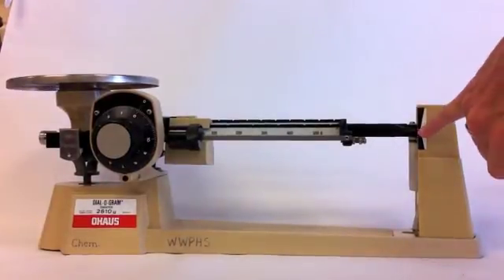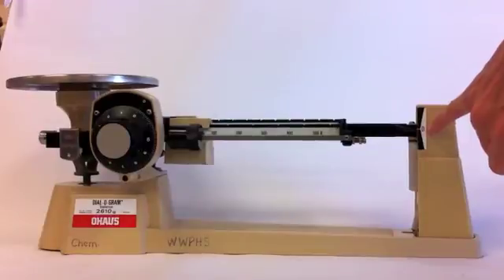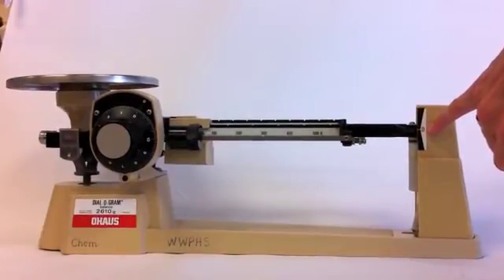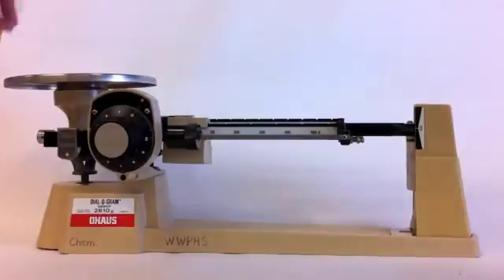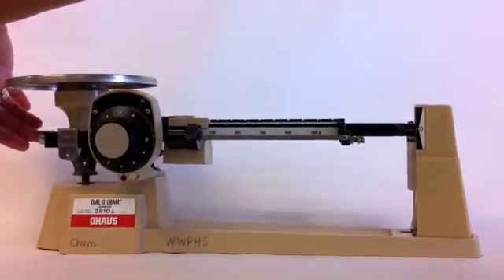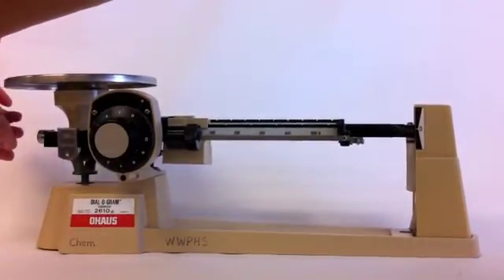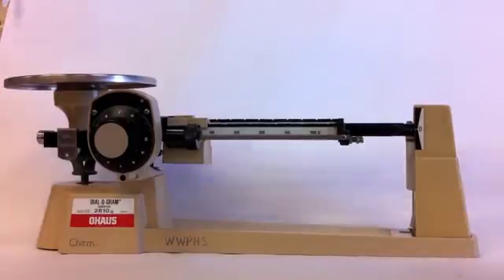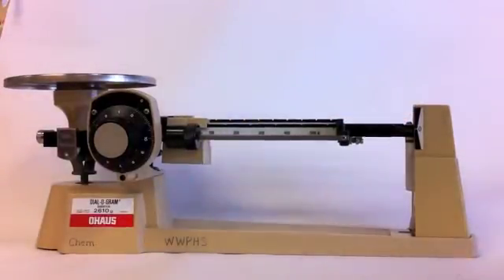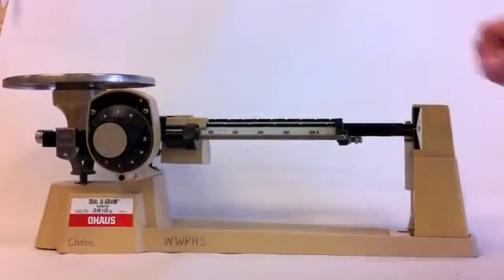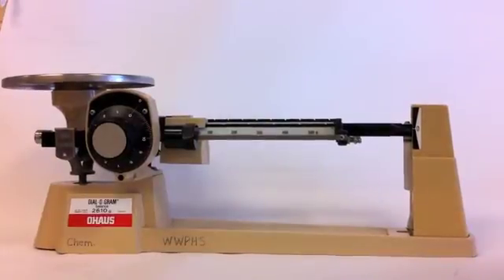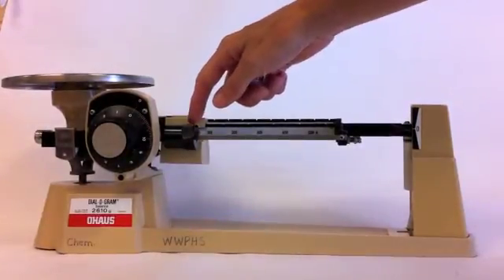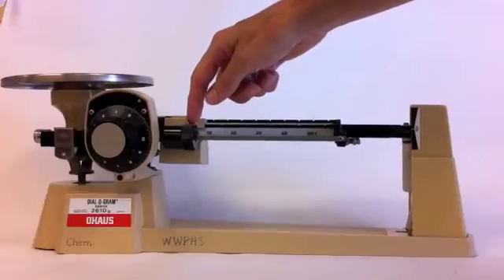You're going to line up the little line with the zero. If it's not, you have two options. Your first option is to use the silver knob at the far end. If you dial it out, it will make the balance come up a little bit. If you dial it in, it will make the balance go down a little bit. If it's really far off of zero, you may need to use the big black knob here.